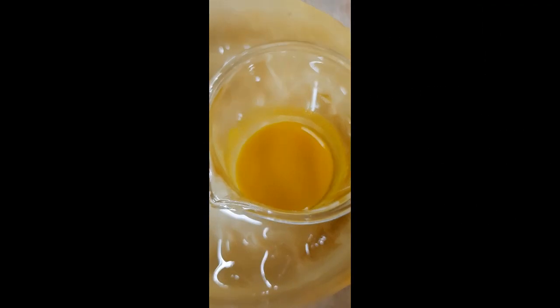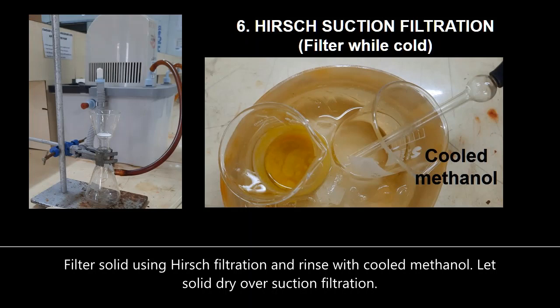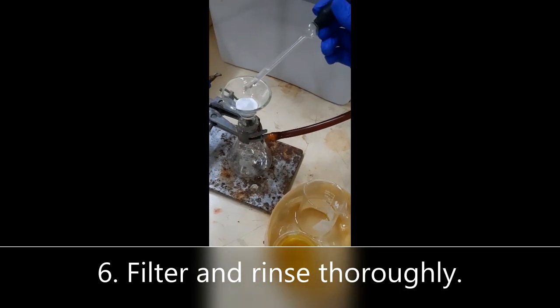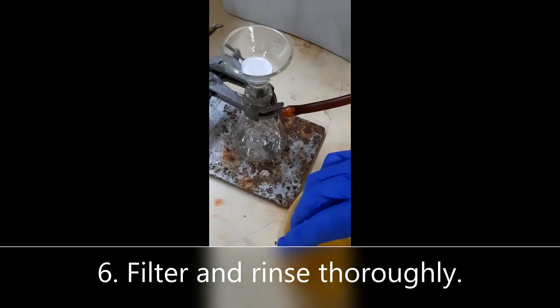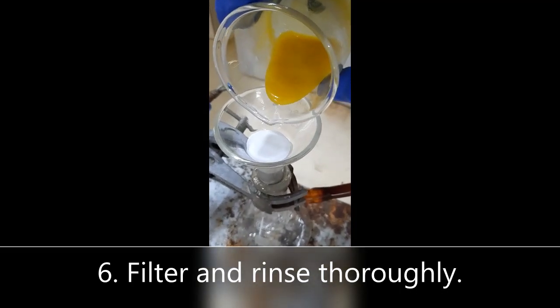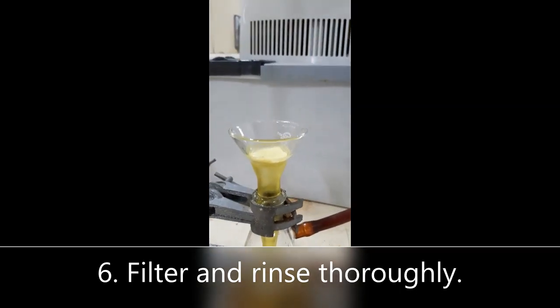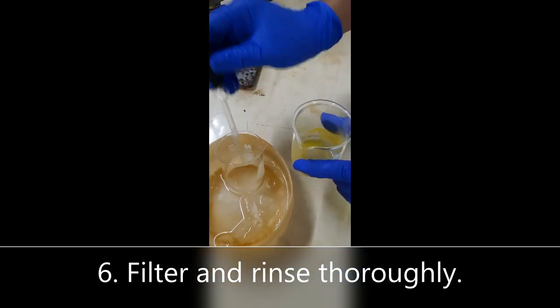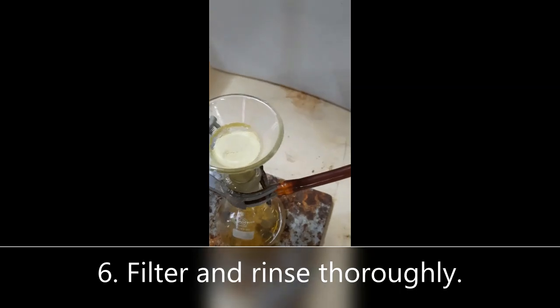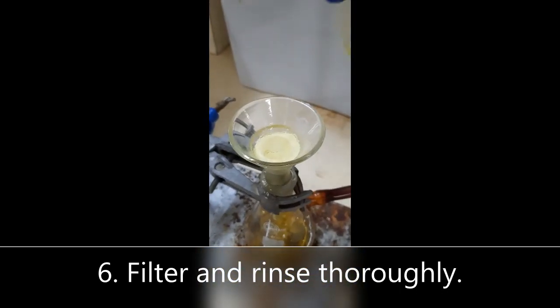The solid formed in the conical flask is then filtered through a Hirsch funnel again, followed by rinsing with cold methanol. Leave the solid to dry under vacuum suction for approximately 5 to 10 minutes. Take note of the technique and the product obtained.